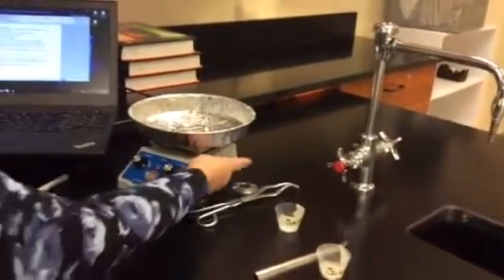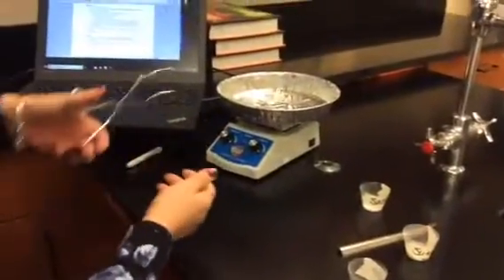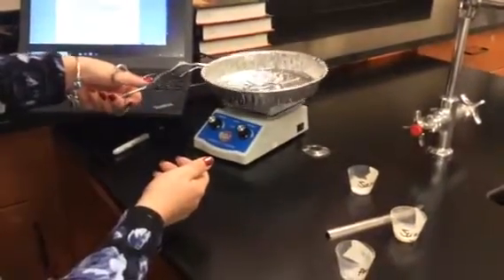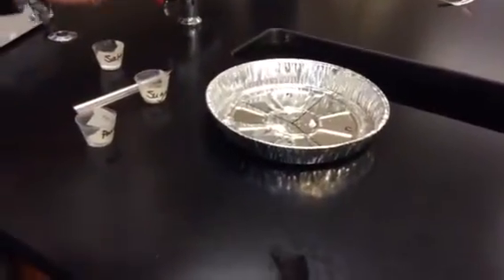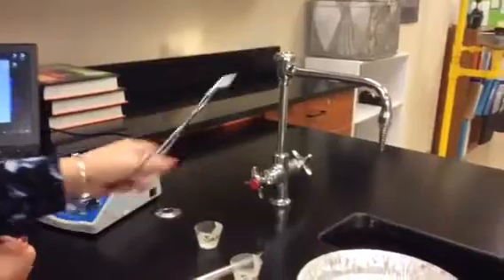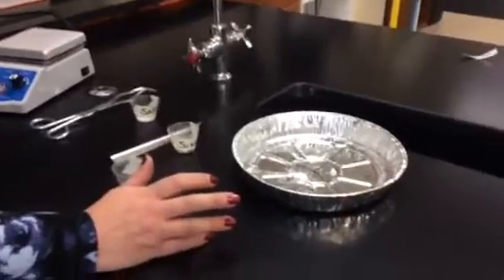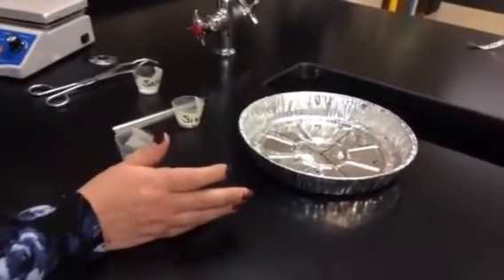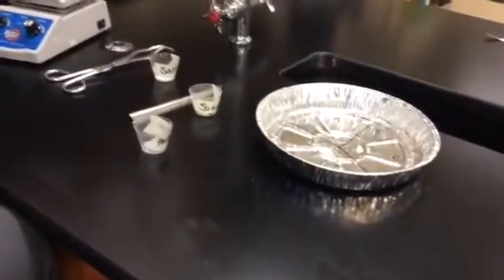After 5 minutes, you're going to turn off the hot plate and unplug it from the wall as well. The pie plate is going to be hot, so you're going to take these, which are a new tool for us, tongs. I don't think we've used these tongs before. Use a pair of tongs and allow the pan to cool. For the cleanup, once this has cooled, you're just going to throw it in the garbage.